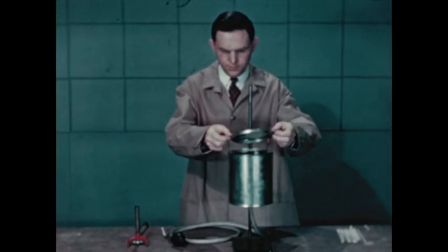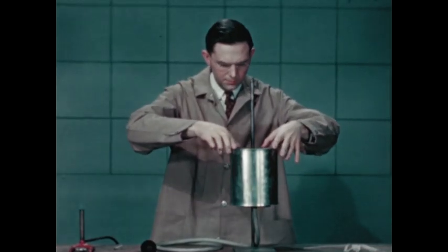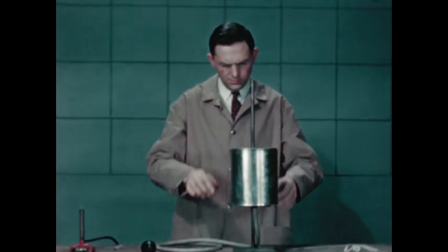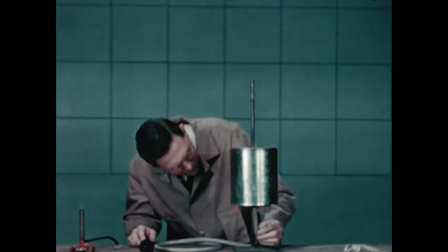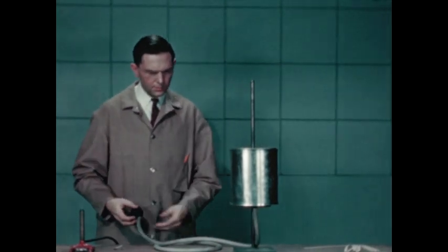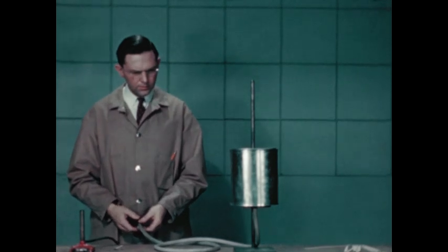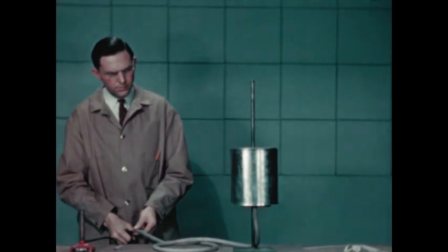Here is another type of rapid oxidation reaction that can be highly explosive. The tin can holds a candle and a funnel filled with fine dust-like powder. Any fine dust such as coal dust or flour will produce the same result. The rubber hose and bulb allow us to blow the fine powder loosely into the space where the candle is burning, and it will oxidize — but oxidation at that speed gives an explosion if the heat and gases of combustion are confined.